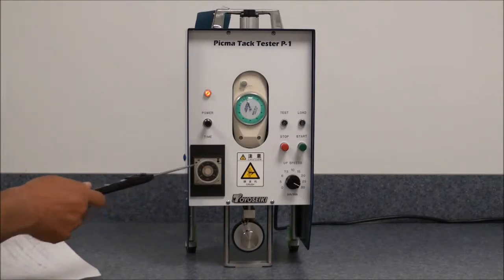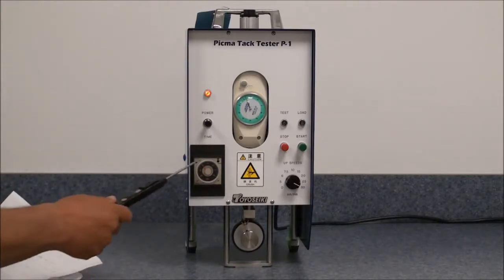You can control the amount of dwell time, contact time, with the timer.